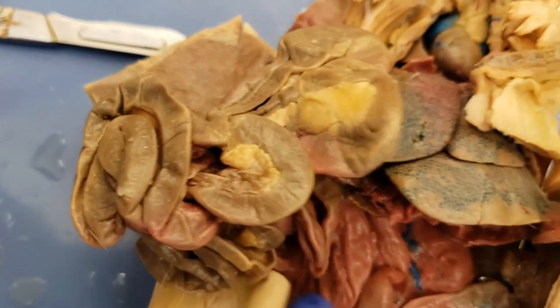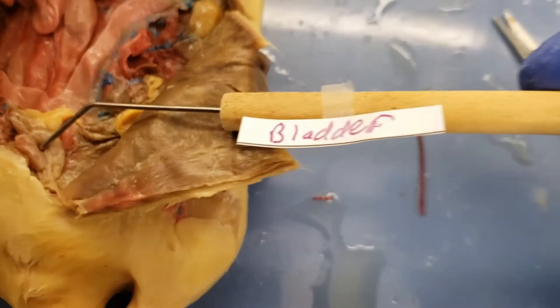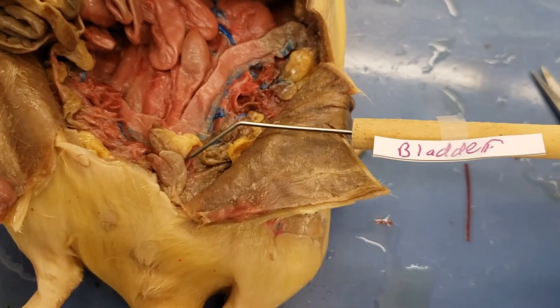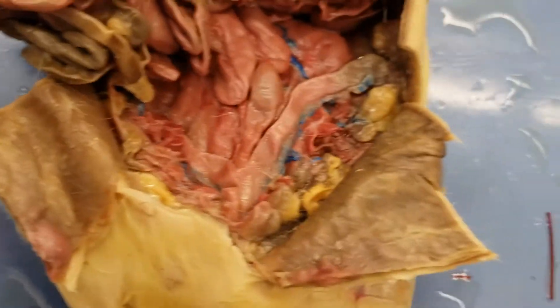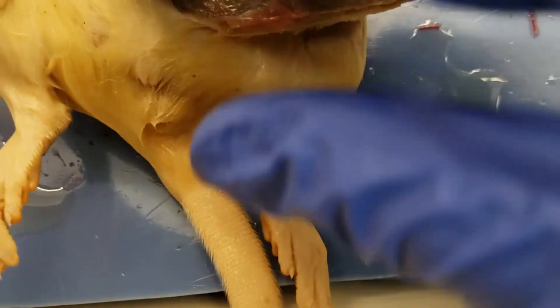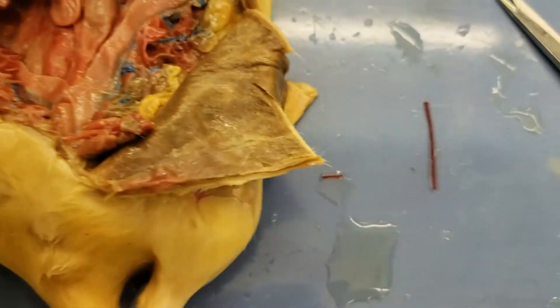Let's go down and look at the bladder. The bladder can always give me a little trouble, but that's a solid bladder right there. The bladder holds pee and can stretch. Later this semester I'll share a fun science-y way to say you have to go pee, but that comes later.